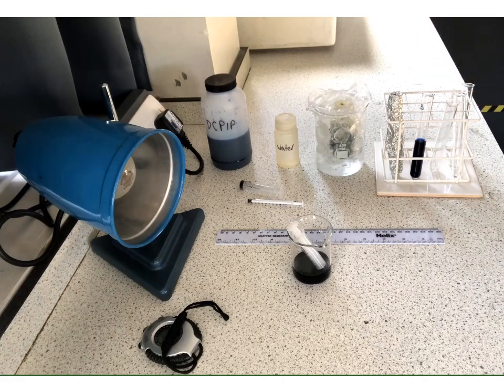What we will now do is set up tube C, which is going to give us an idea of colour change so that we've got something that we can compare to. Because in this investigation, although we are looking for a colour change, we are not using a colorimeter. So we are judging it by eye. So there's a lot of room for human error. That's why it's good to set up a tube that we can compare to.